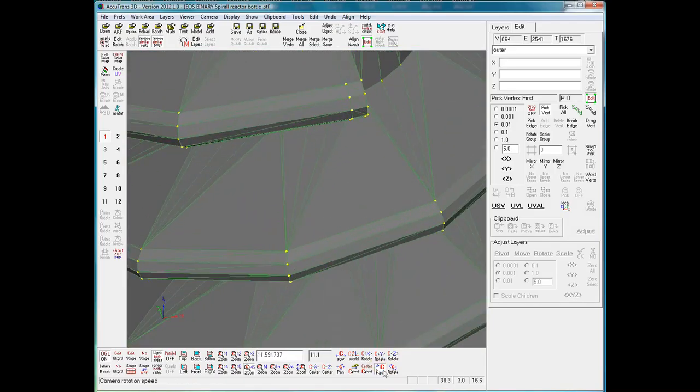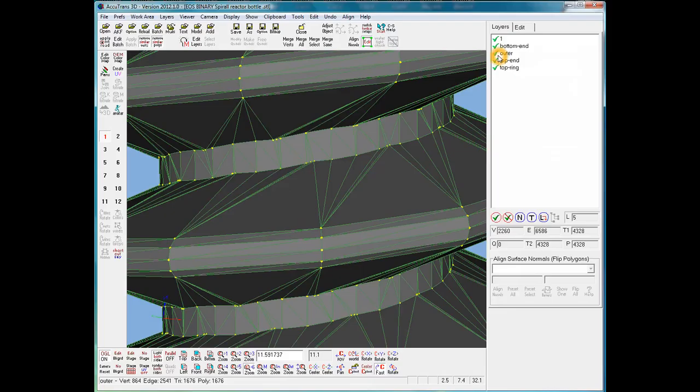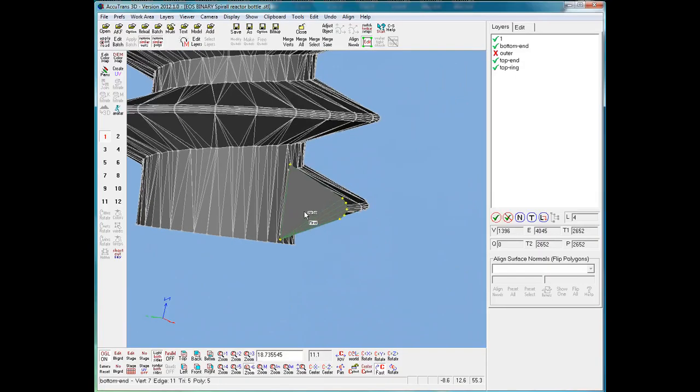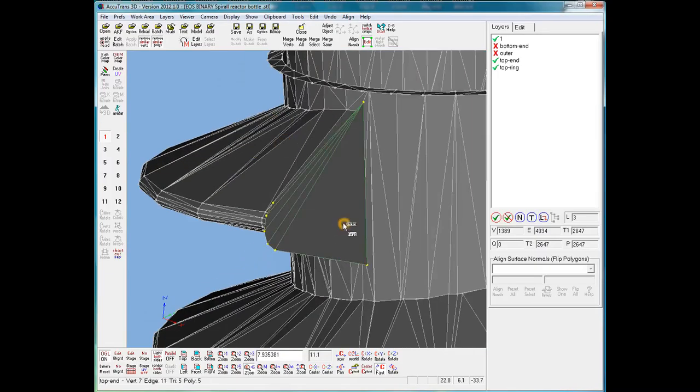So now we can zoom in across all the layers, going up and down to see if there's anything that looks wrong. When there's nothing wrong, I then just have to hold down the control key plus the shift key, click the right mouse button, and the layer should deselect, but it's not. So I'll go to the layers menu and click on the outer shell to turn it off. Then in the same way, we can look at the two ends. I'll right click on the end, go in. Once you know it's okay, then you can just turn it off, and this time it worked. You don't know what's going on when you're capturing. We do the same thing here, and again it works.